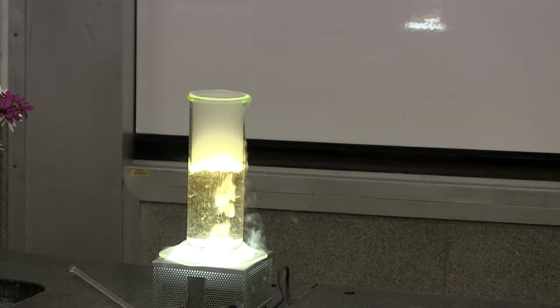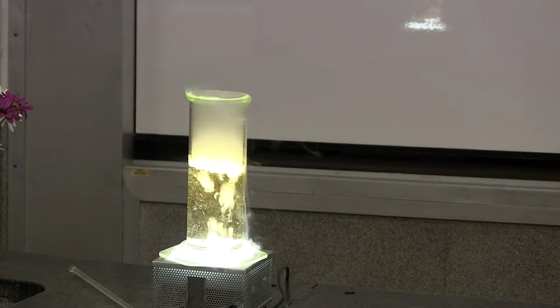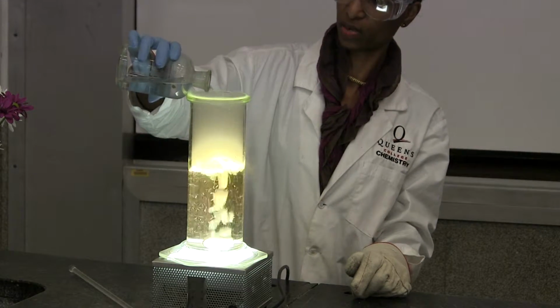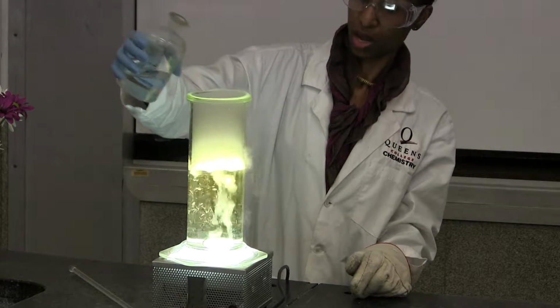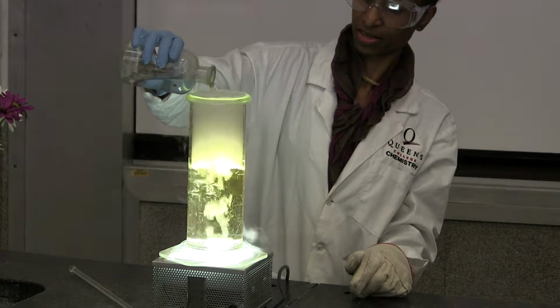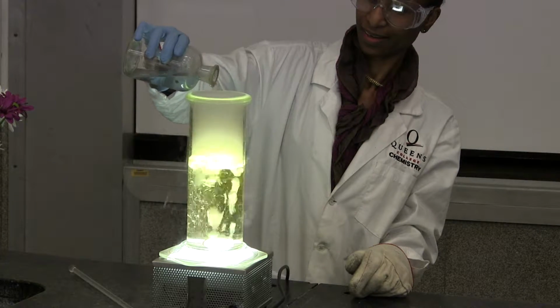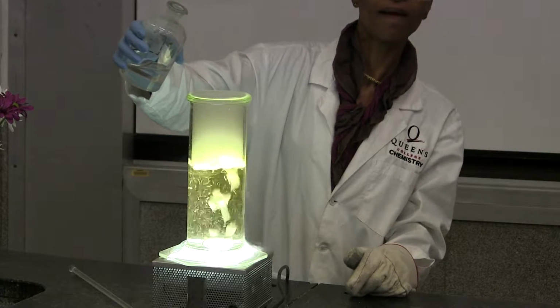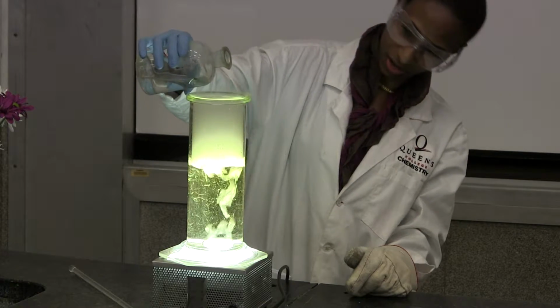You want to turn it back? What do we do if you want to turn it back? We put in the base. Let's see what happens. See if we can change the color. Get in there. Think I have to use the whole bottle? Maybe. Why is it taking a while for the color to change? Because there's still more carbon. We still have some CO2 that's not dissolved.